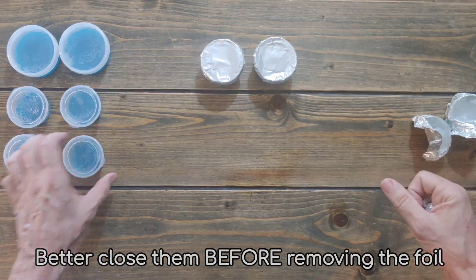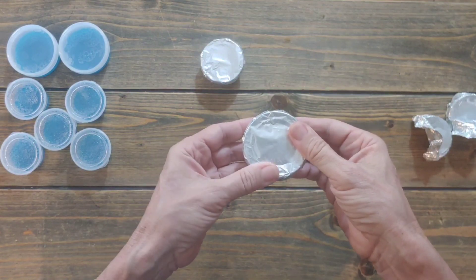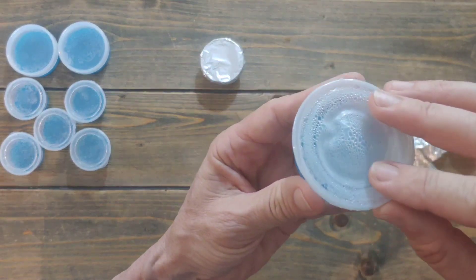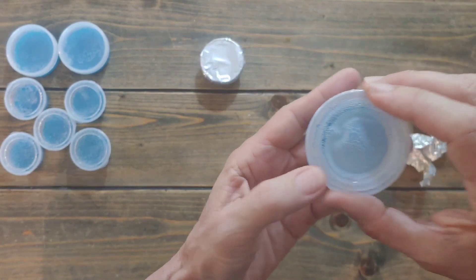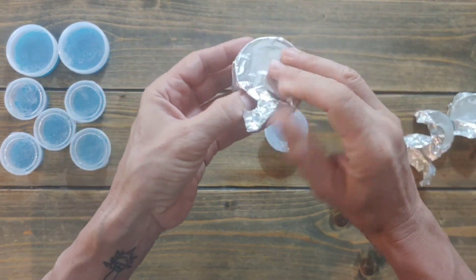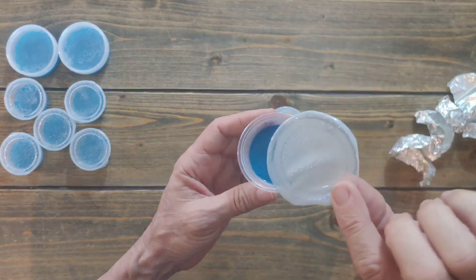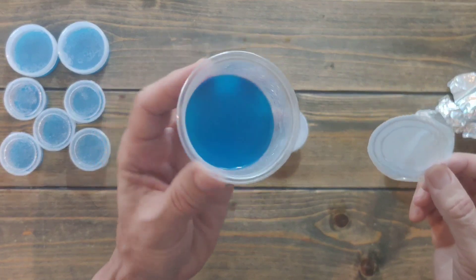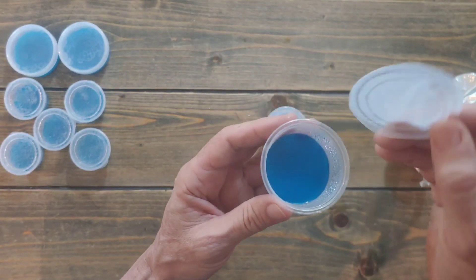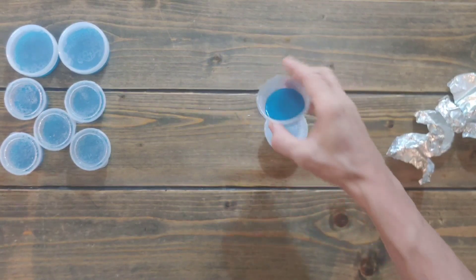Now let's see what happened with the ketchup cups. The lid melted — see this one? Interesting that the lid melted. That is weird, but the cup itself was fine. That's sad — it would have been great if the lid hadn't melted, because the cup is perfectly fine. Before and after — the cup survived but the lid did not.